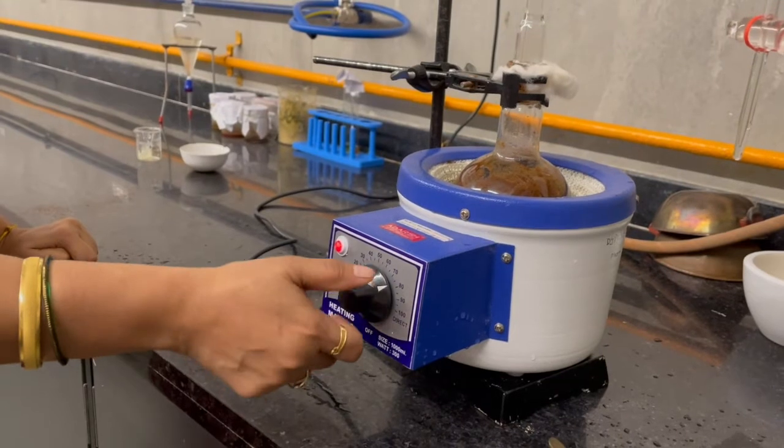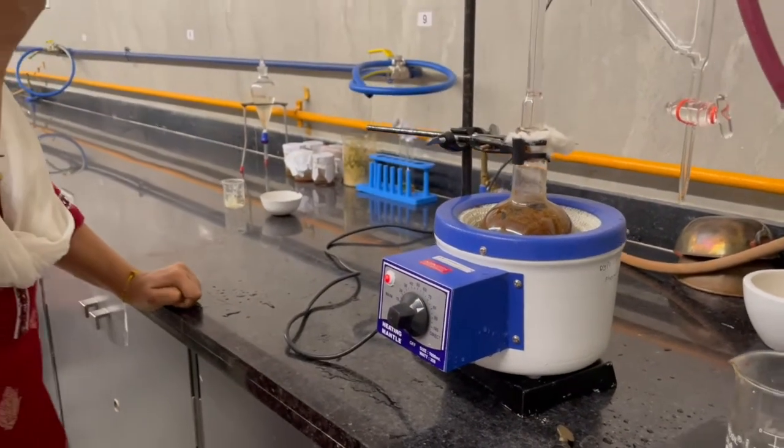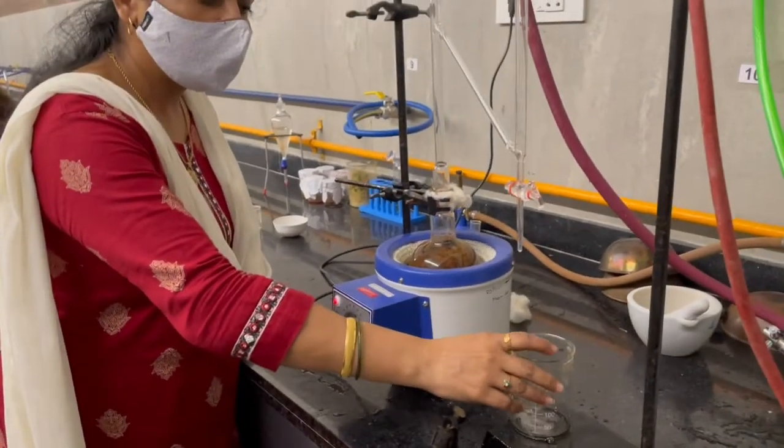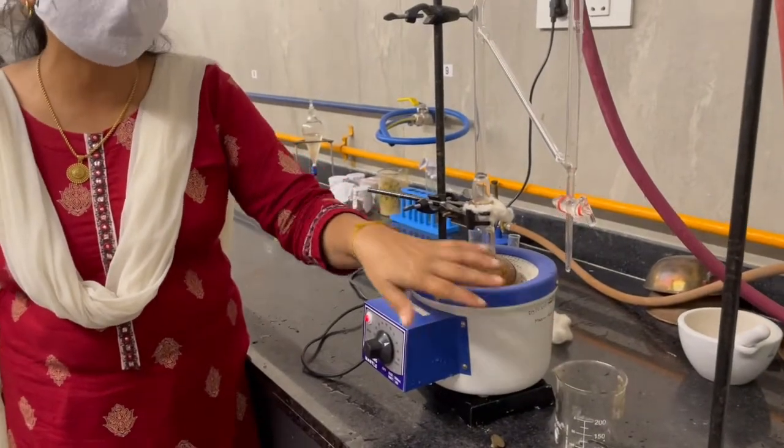Start your assembly. After half an hour, we will get the condensed liquid as clove oil.